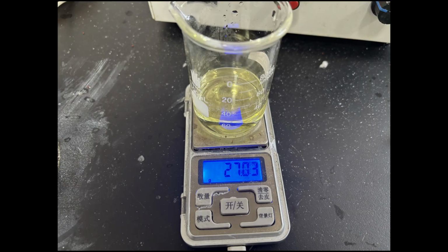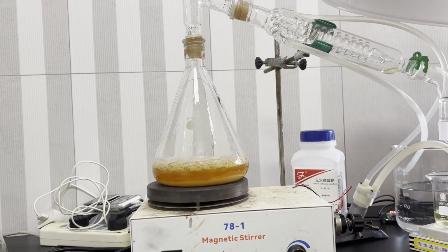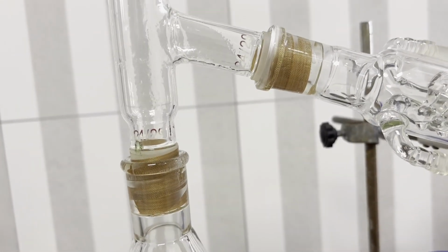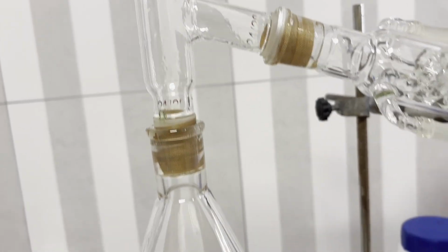The first bit of acid with a lot of bromine contamination weighs 27 grams and only has a density of 1.1 grams per ml, or 14%. Combining all three, the yield of hydrogen bromide was 88.5 grams, or 54%, which was quite bad actually. I should have used a much larger excess of sulfuric acid to force all of the hydrogen bromide out. But this is more than enough for my IA.